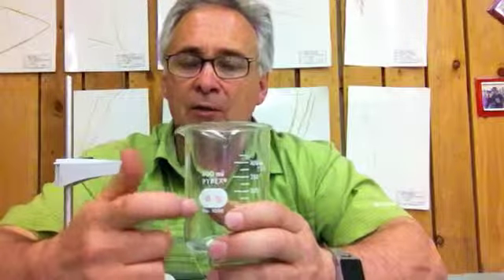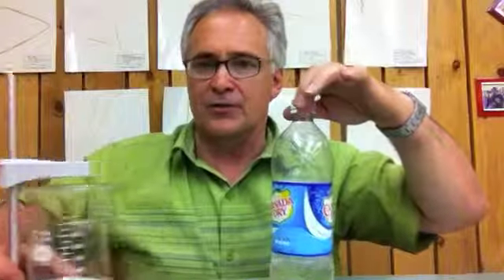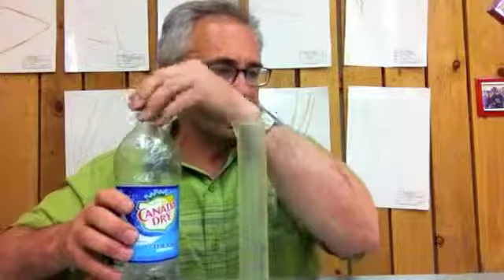So we have our 200 ml beaker or 400 ml beaker. You have your magnet, you have your stir plate. You're going to also get some club soda, and you're going to need 100 ml. So let's go ahead and get that. I'm going to push this out of the way for just a second, and I'm going to get a graduated cylinder.